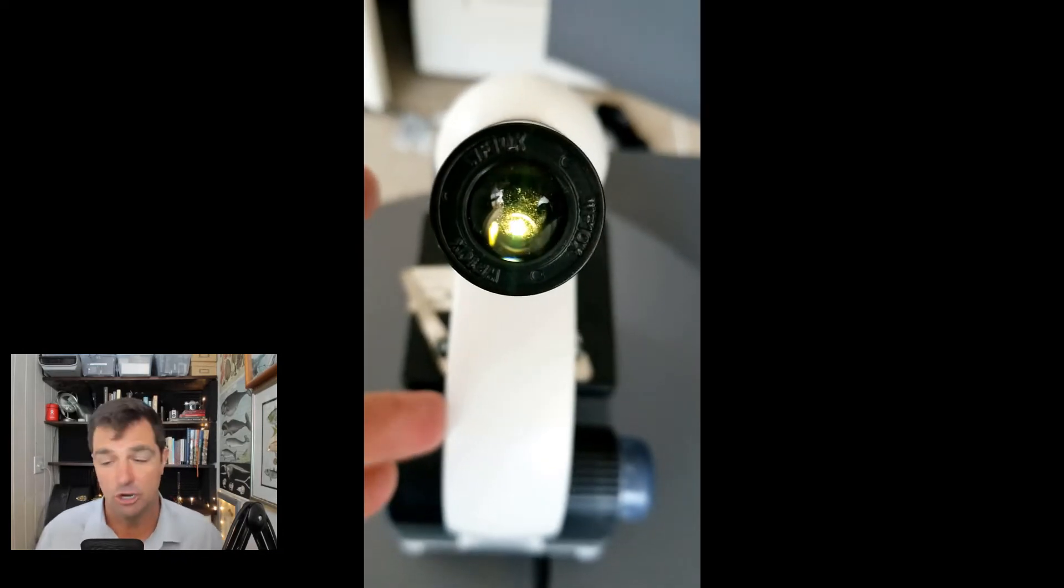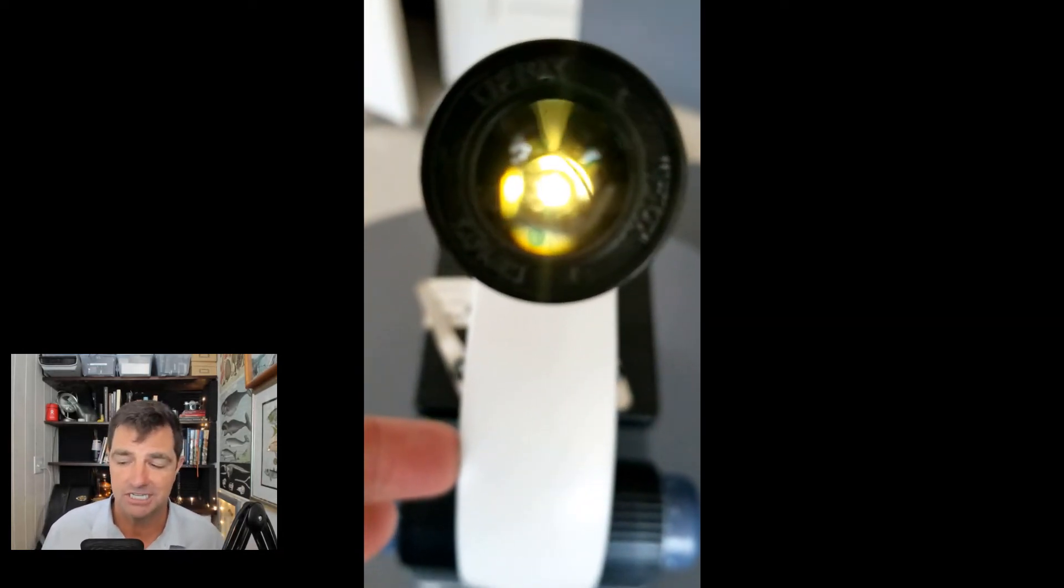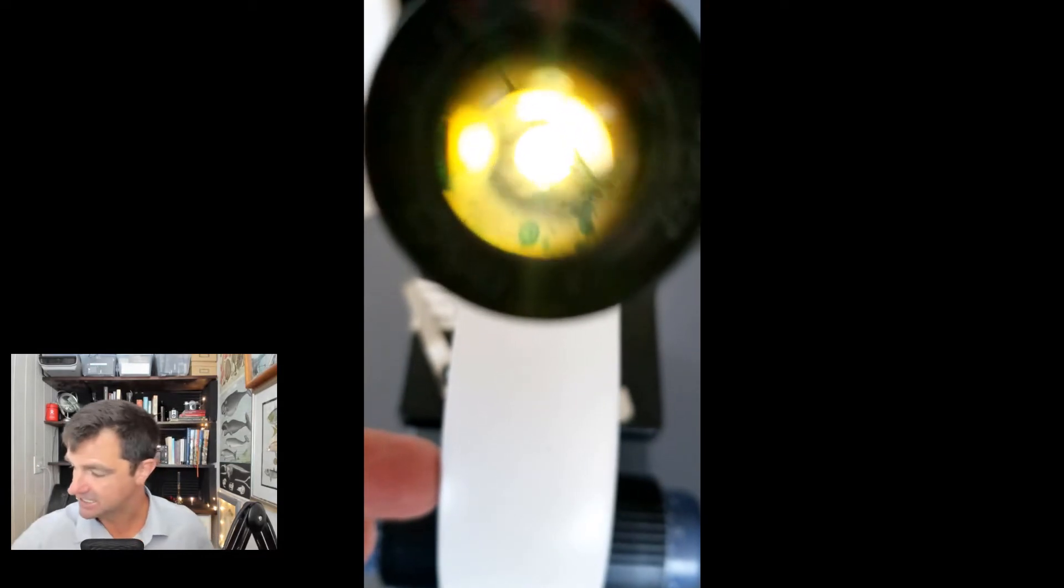You can also take a picture or video of what you see in your microscope. There are different devices for this.